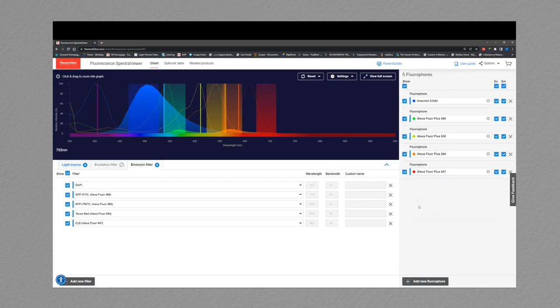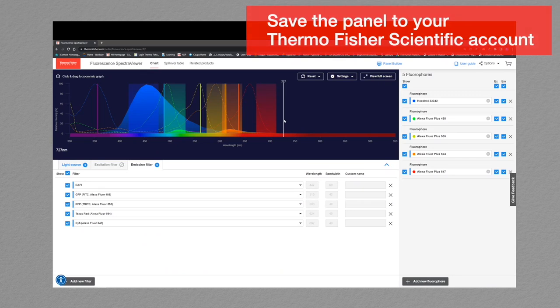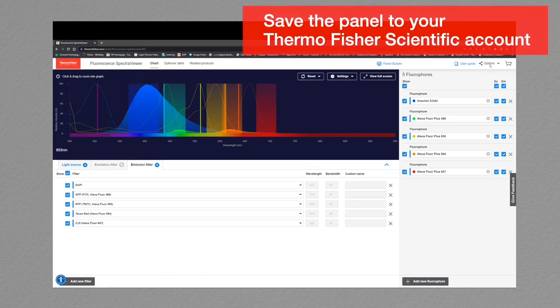Once you have done this, you will see both the absorbance spectra shown with the dotted line and the emission profile with the shaded under peak in solid blue. You can now view the excitation and emission profiles along with all of your chosen filters. To finalize your instrument setup and fluorophore selections, save your panel build to your Thermo Fisher account by just simply going up to Options, clicking on Save, and saving your changes.